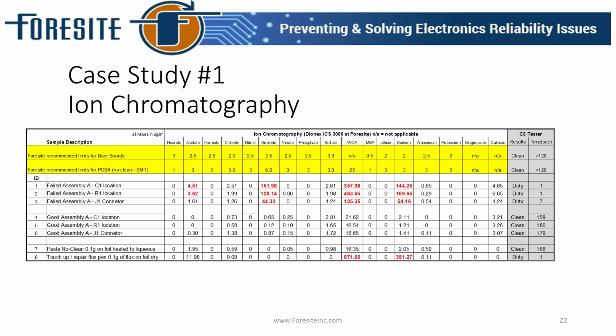In the failure, we saw high levels of bromine, which is typical for a board that has been burnt. The bromine is a flame retardant built into the system. It's designed to help minimize thermal events, so we see high levels outgassing from a board that has had a thermal event. But what we typically don't see are high levels of weak organic acid.